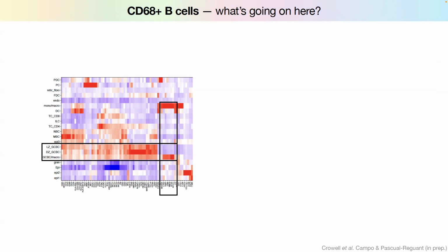This is marker genes, and that's our cell type. And what I'm highlighting here is that these are B cells. So you can't read it, but there's some B cells in here. There's CD79 in here. And those are macrophages. So there's MMP, APOE, lysozyme in there. Okay, great. But what's this? It's a cluster that is a CD68 positive B cell cluster. And this is really strange, right? In single cell, you would call this maybe a doublet. But it's also weird that there's a doublet forming between exactly these two cell types and nothing else.